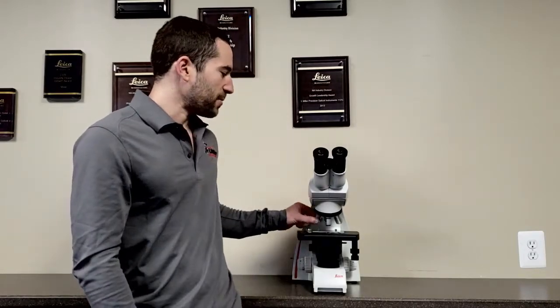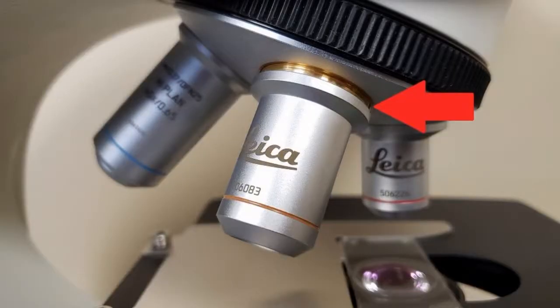Second, check the objectives themselves. Perhaps during use, they became unscrewed and unthreaded, and you just need to tighten them up. You may also be using objectives that aren't right for your microscope. They could require shims or just some other changes.